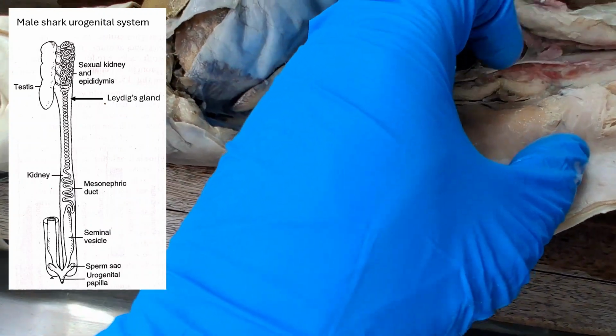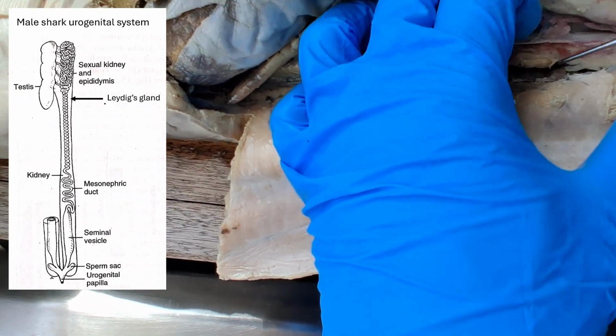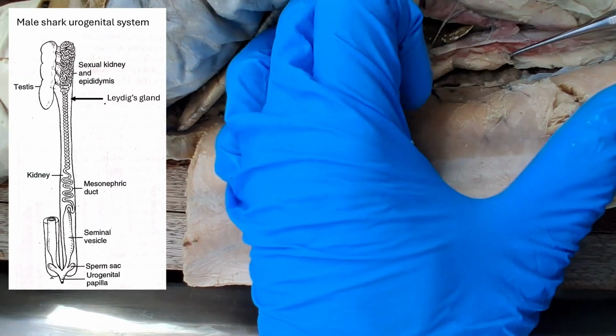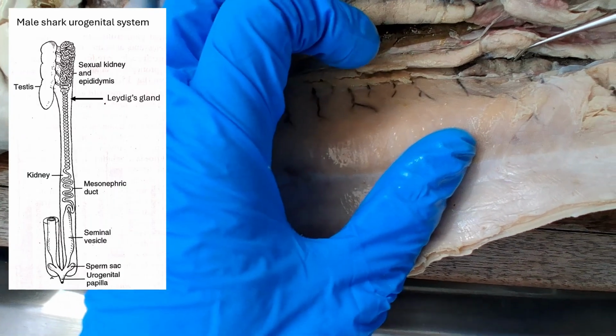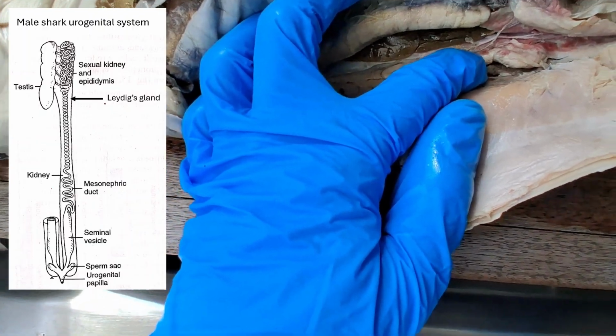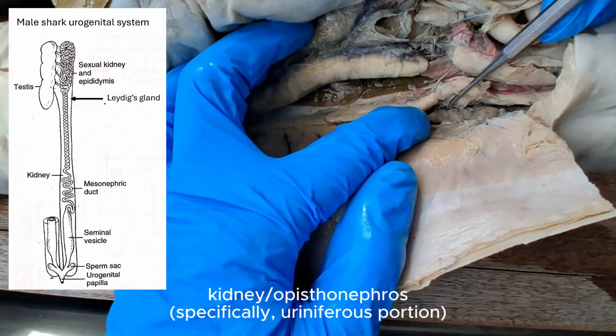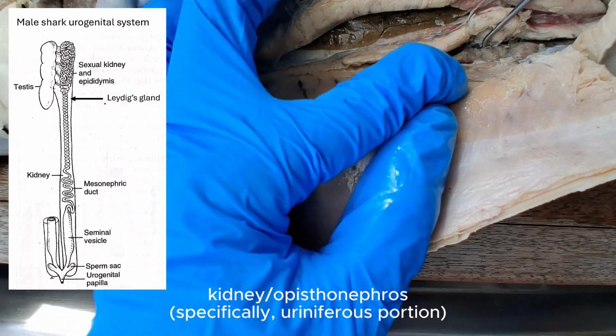The caudal end of the opisthonephros, here, you see that dark mass there? That caudal portion of the opisthonephros is the only uriniferous portion of the kidney. So this is the legit kidney that produces the urine.